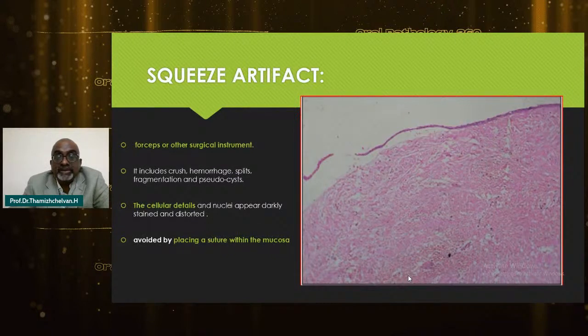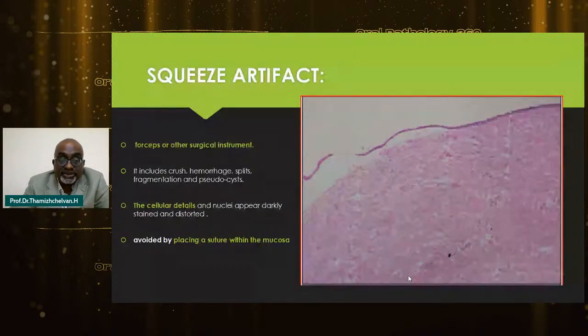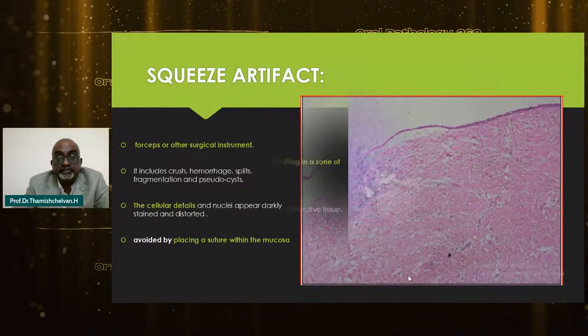And we also have the squeeze artifact, because surgeons normally tend to hold the tissue with forceps. This will include crush, hemorrhage, and splits. Also, the epithelium might be distorted in many cases. Here, the cellular details and nuclei are darkly stained and distorted. This can be avoided by placing a suture within the mucosa.